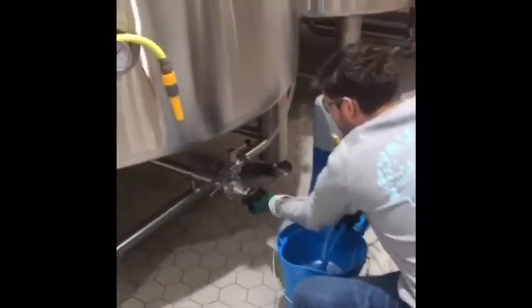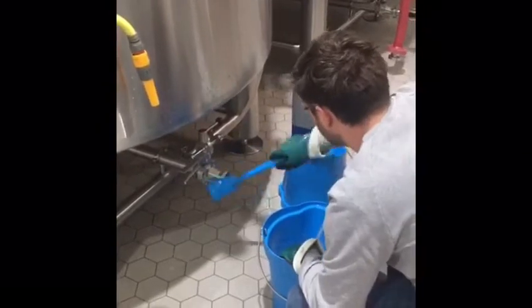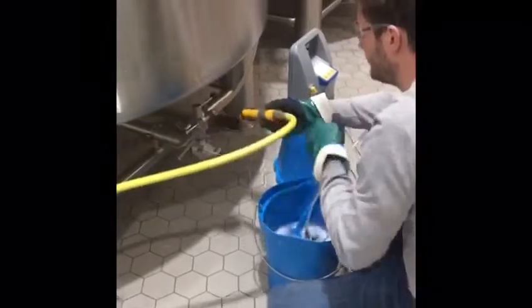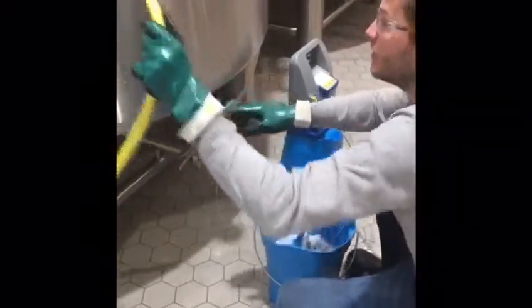We're also using the Beverly to check finished beer in tank for dissolved oxygen. Lance here is just going to demonstrate the process for how we take dissolved oxygen readings from beer in tank.